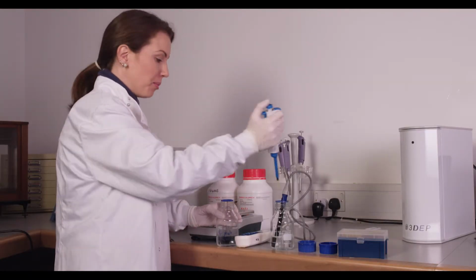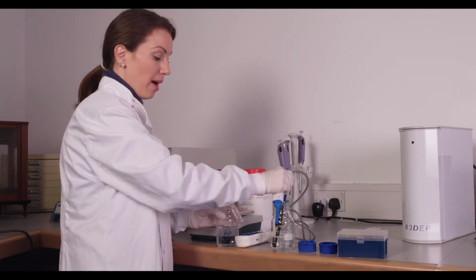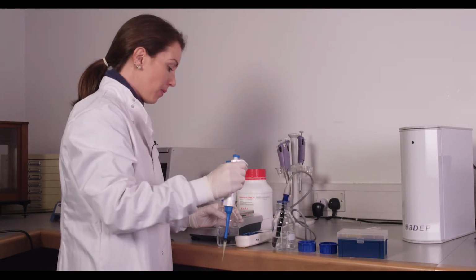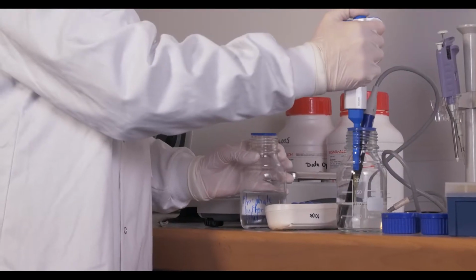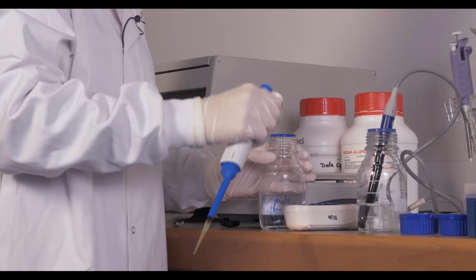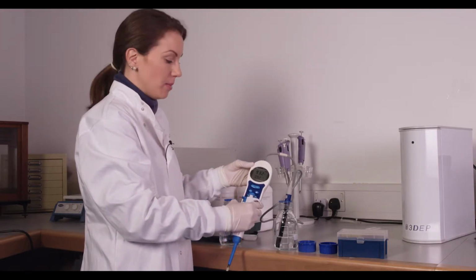While this is a slow process, it's better to do it in small steps of the PBS than to do it too high steps and end up going past the conductivity that you need. And you'll see after 4 additions of these 75 microliters, we're at about 93 microsiemens per centimeter.